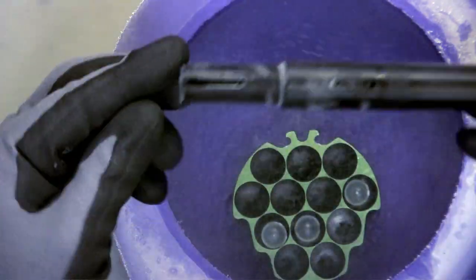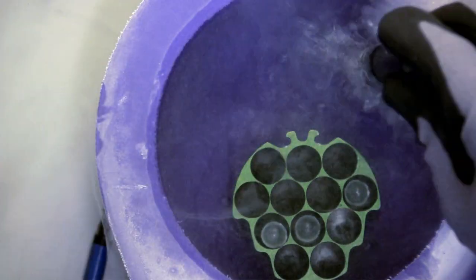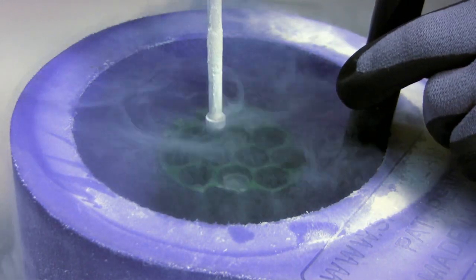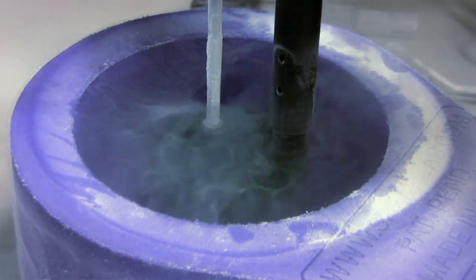Once the samples are loaded, ensure they are fully seated. For uncapped samples, the black tool with the small opening is used. Cool it off, then place it over the sample, giving a twist at the bottom.